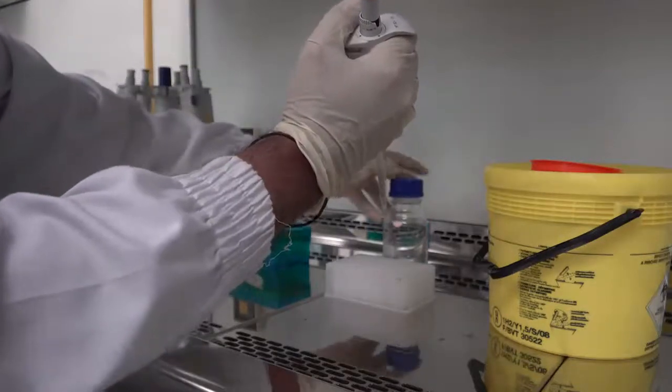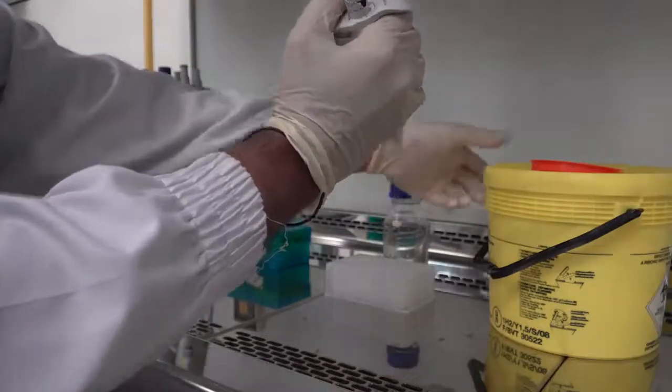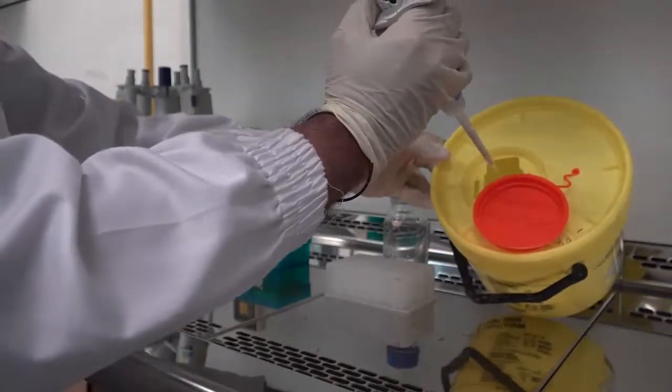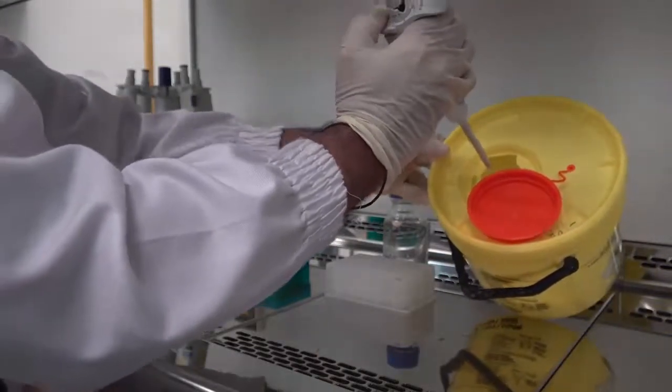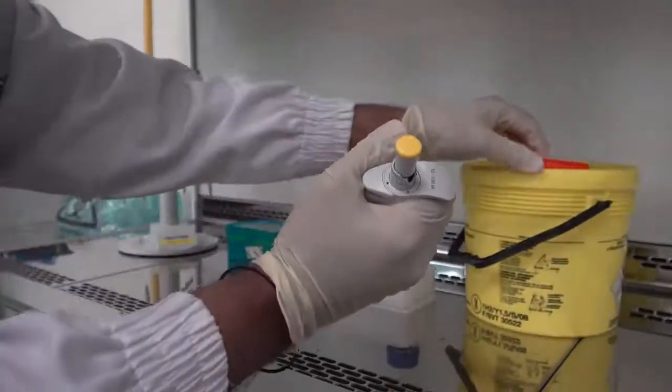When you complete dispensing the sample, the tips can be disposed in the waste container.